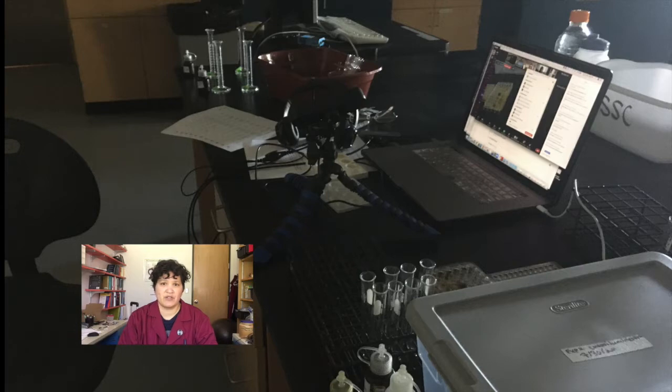Hooked up to my computer, I have a webcam. So at the beginning of the session, I'm actually using the webcam that's built into my computer, but I have an external webcam, which I set up on my little hiking tripod and focused in on the area where I was doing the experiment, and I can switch back and forth between them. Let me show you what we did.